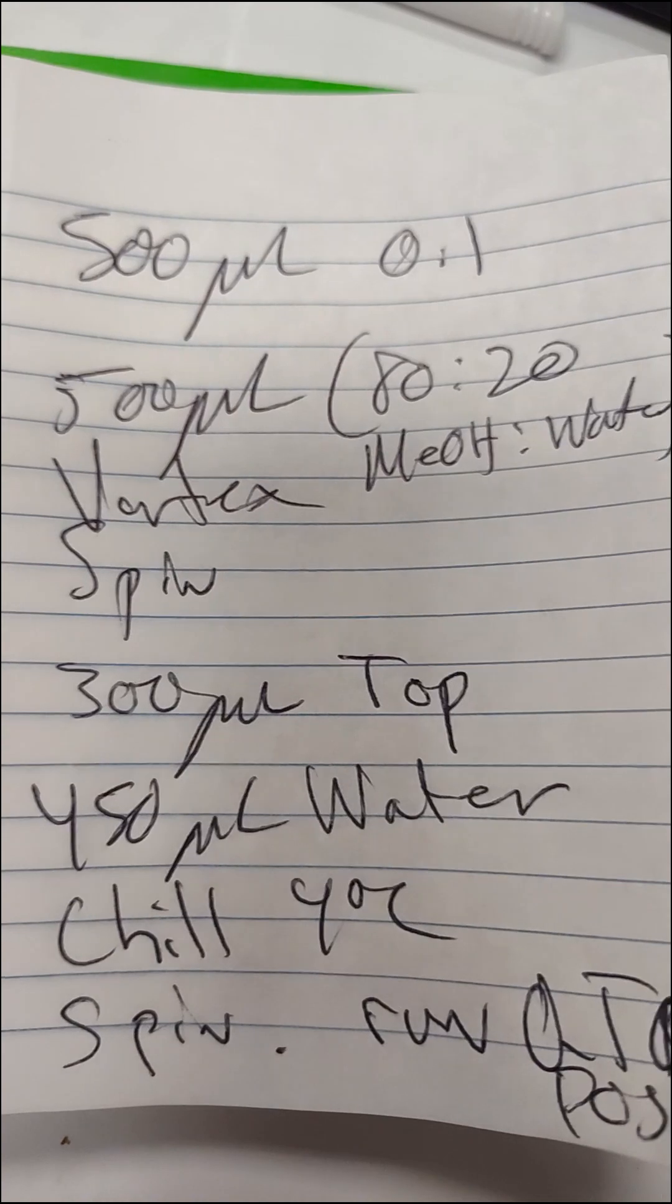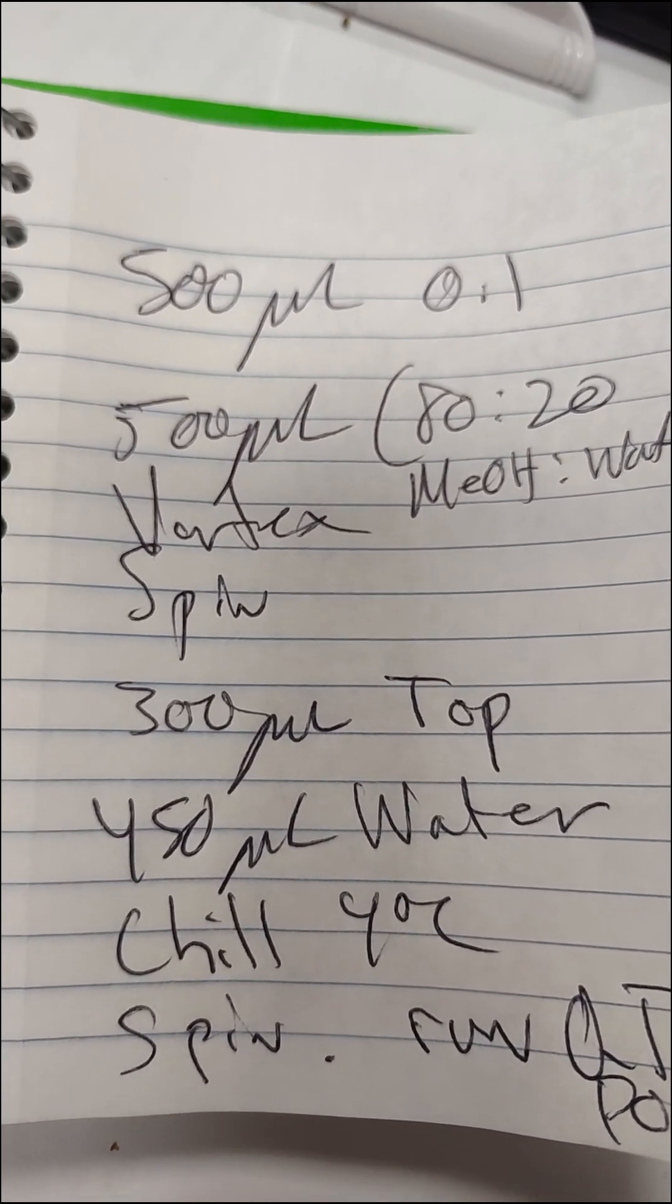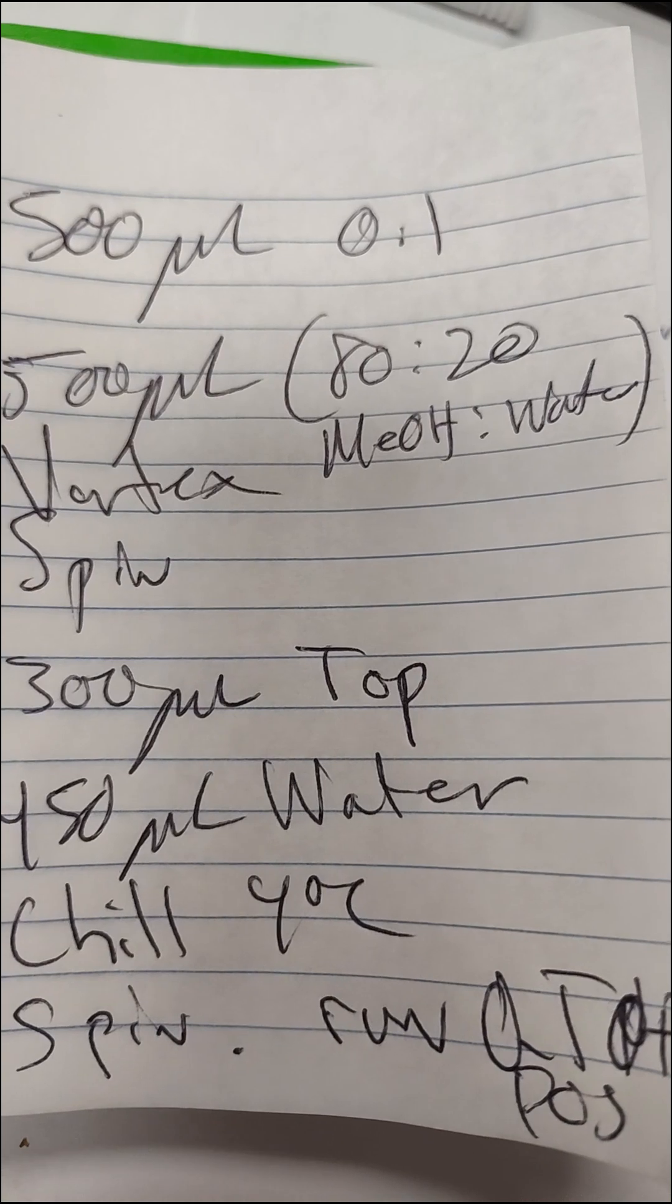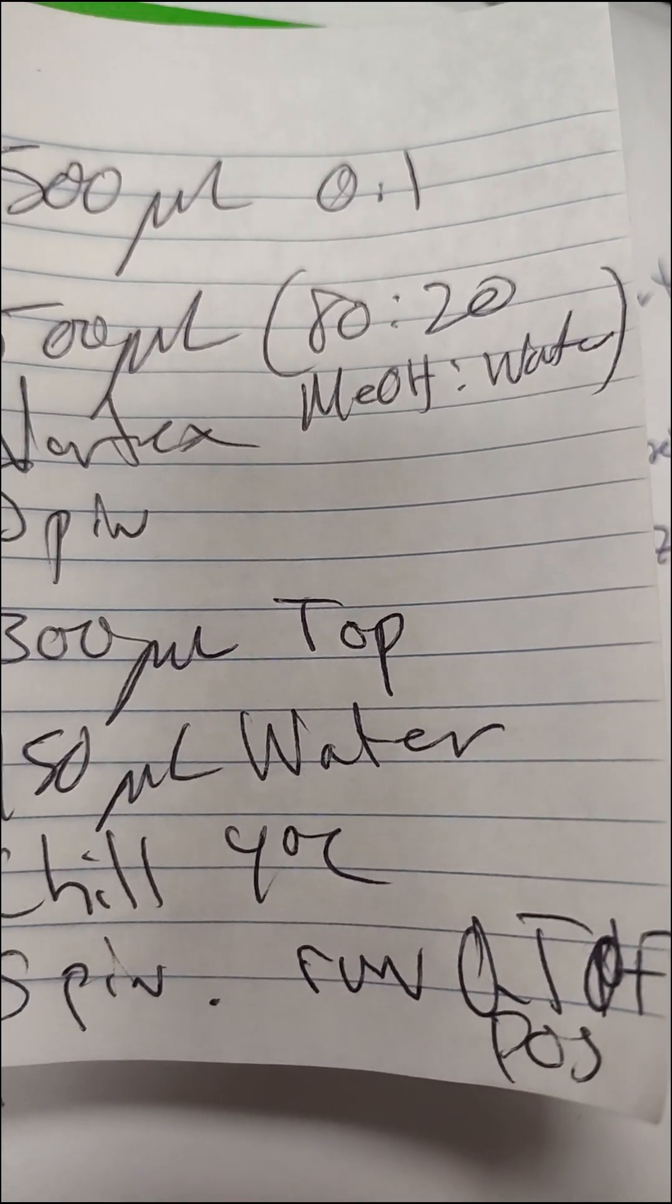450 microliters added of water, chill it at 4 degrees, then re-spin it. And then that sample, I may dilute it more. We'll see how concentrated it looks. Onto the Q-TOF. And they're saying positive mode, C18.